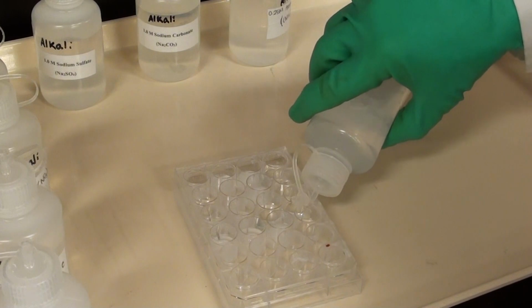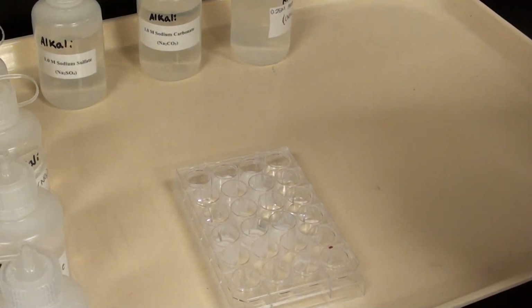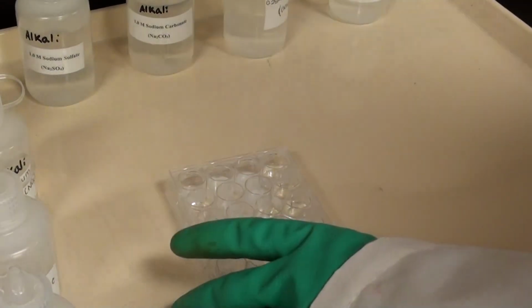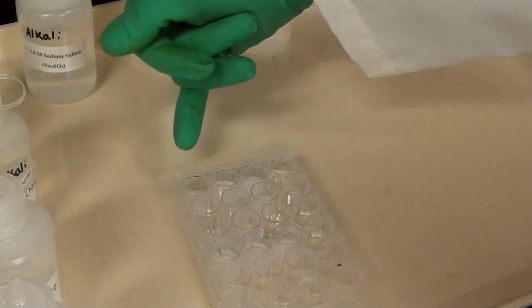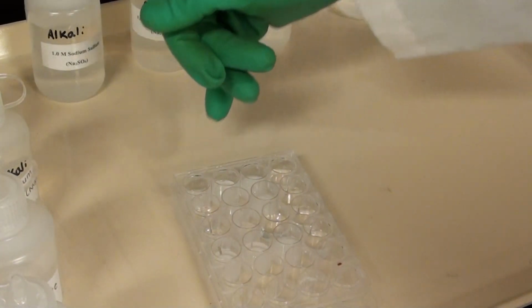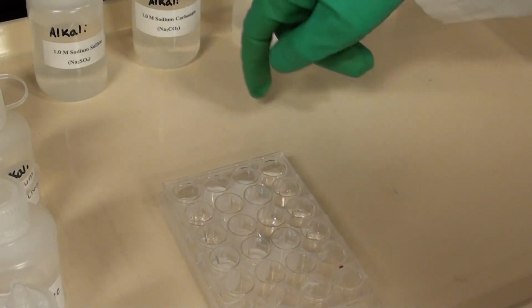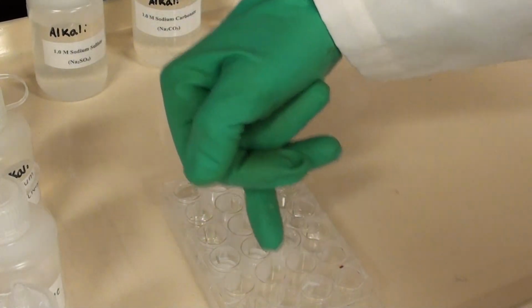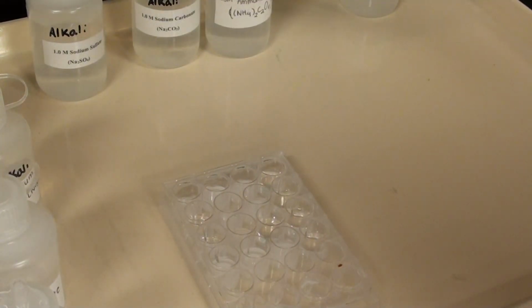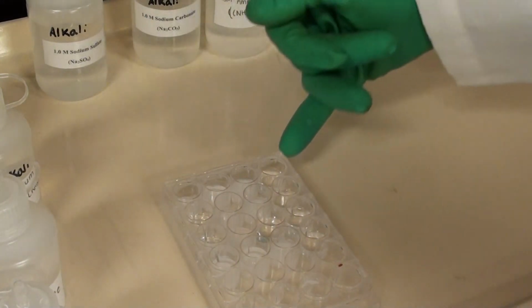So I'm adding roughly 5 drops of each of the anions. You can see what he did there. Could you say the anions again, please? So again, the first row going down, that was sulfate. That's the SO4 on your data page. Then I've sodium carbonate. That's the second column down. The third column is the ammonium oxalate. And then finally we have the potassium iodate down here.